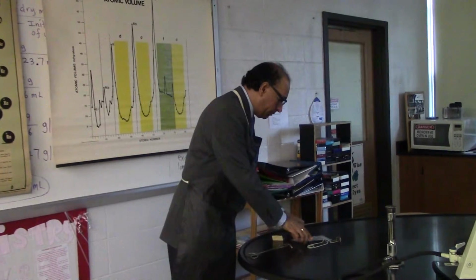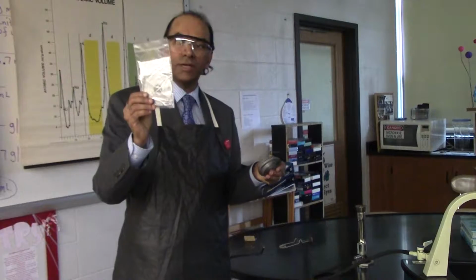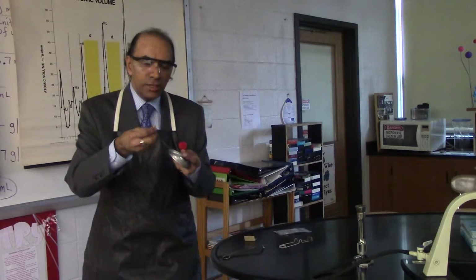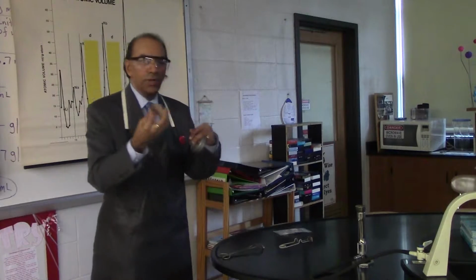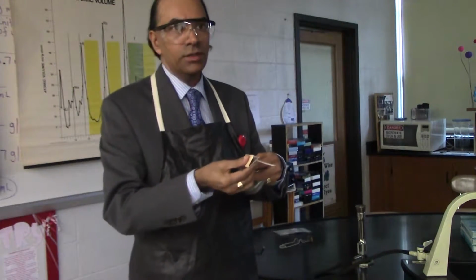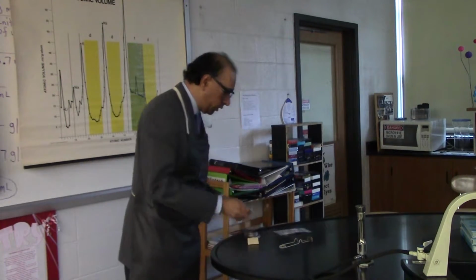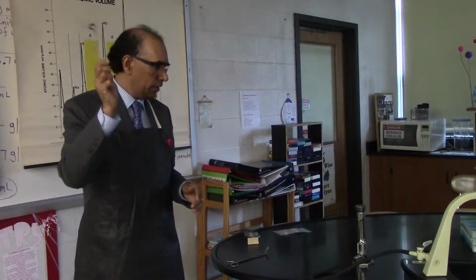So what I have in front of me today is my magnesium ribbon. I have a new set of magnesium ribbon inside my container. I have magnesium ribbon that has magnesium oxide on the outside. So what I do, I get my students to remove the oxide layer using a piece of sandpaper, right? And this is a physical change, which is something that can be discussed with students also. I also have my crucible tongs and I have my flint lighter. Okay, so let's get started.